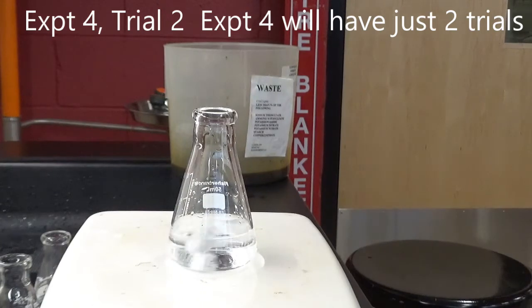Sorry, it's a little boring. I have great anticipation of that purple color coming any moment now. These long runs, we're only going to do them twice, so that's the consolation.